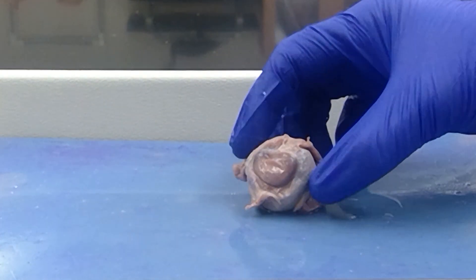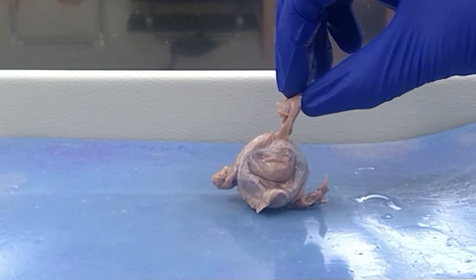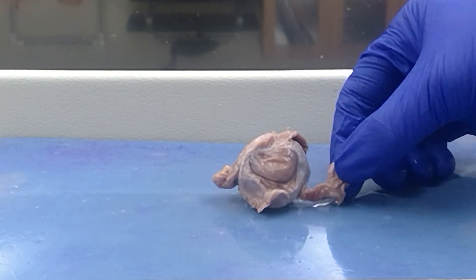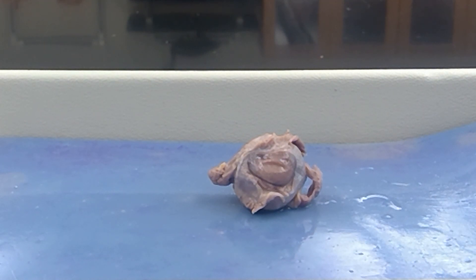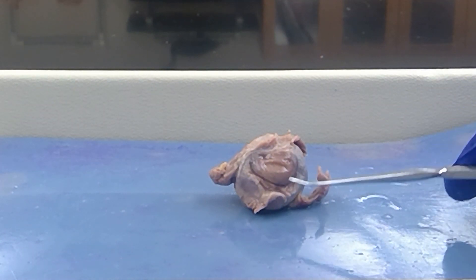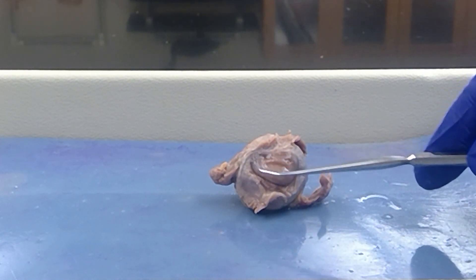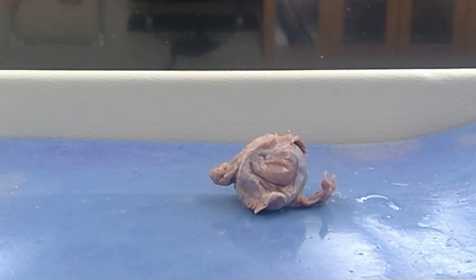The first thing I want you to notice before I cut into the sheep eye is that we see a lot of the extraocular eye muscles — eye muscles that you learned in class like superior rectus, inferior rectus. The next thing I want you to notice is this structure here: that is the cornea, and the white substance here around the sides, that's the sclera. The cornea and sclera are part of the fibrous tunic.